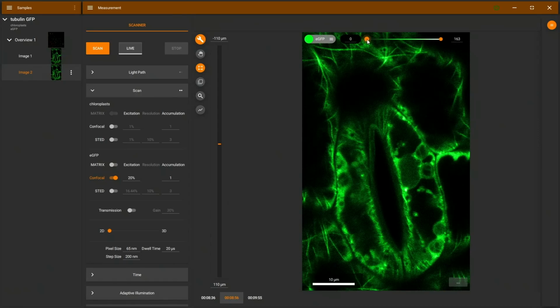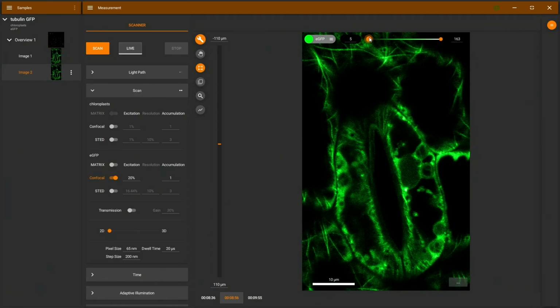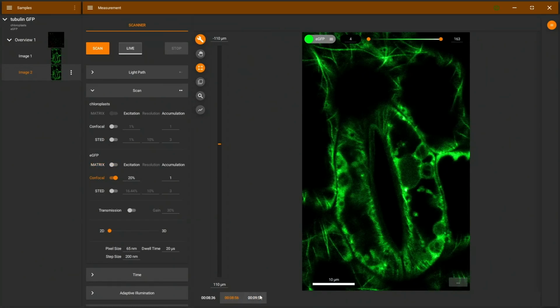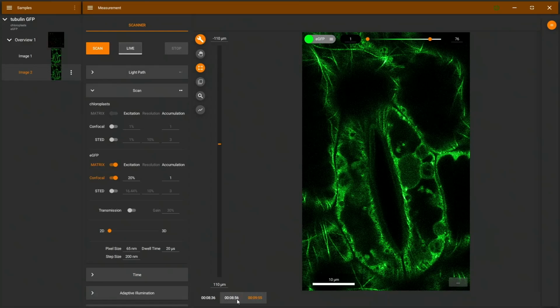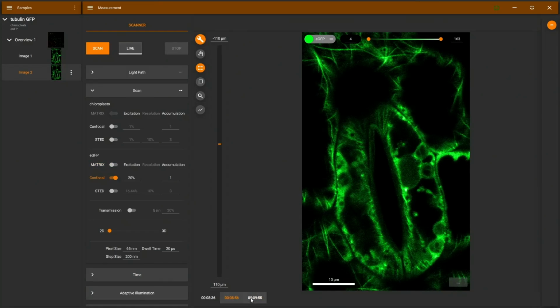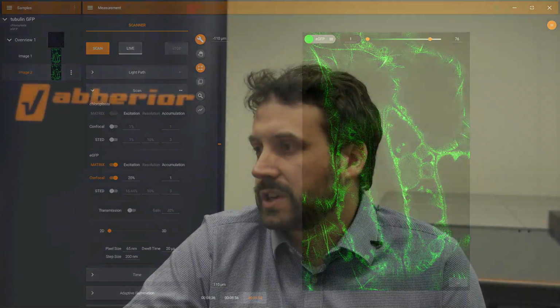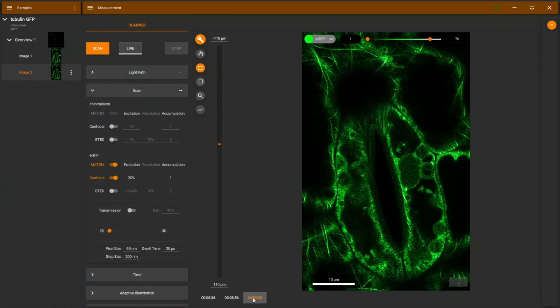Comparing this to the confocal image with an adjusted lookup table, we can see we can't really get rid of the haze just by using a different lookup table. We need the matrix post-processing to get a really sharp image with all the out-of-focus light rejected. You can also see there's still a little bit of chloroplast autofluorescence there, but also we can see the difference in the sharp structures here, the dense areas.